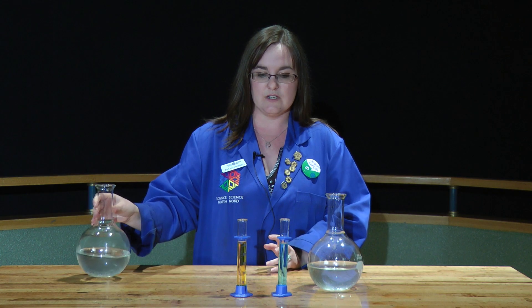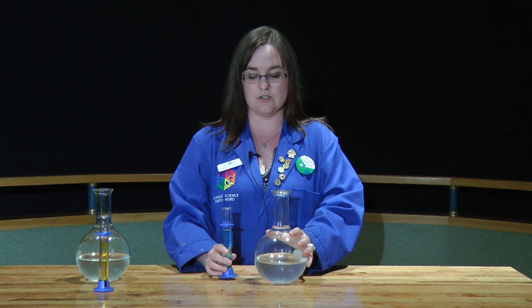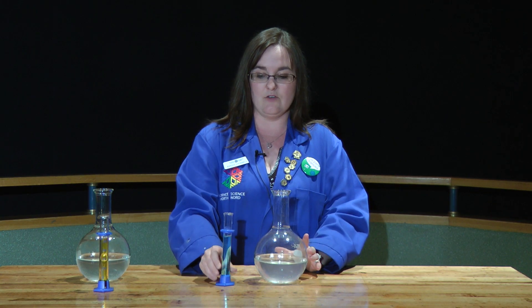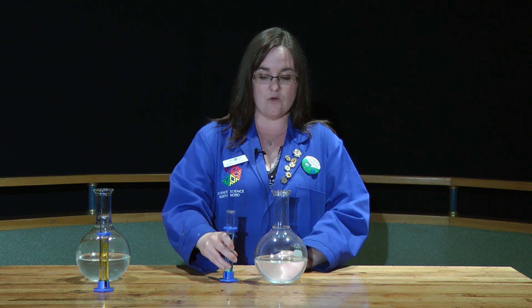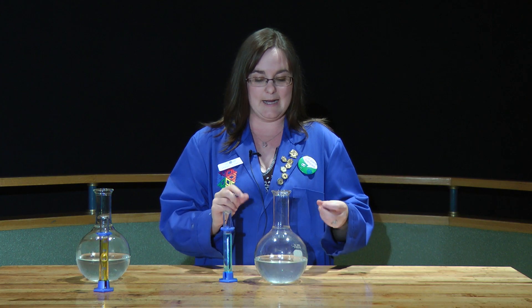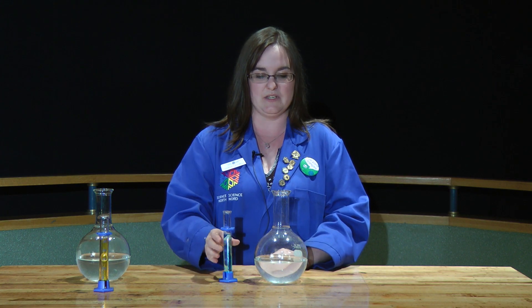The first we're going to do with these two substances here. In the round bottom flask, I have sodium carbonate solution. And in the graduated cylinder, I have copper sulfate solution. Now, when we mix these two together, a reaction ensues, and one of the products is not soluble in the other. So you get this solid kind of little tidbit stuff out of it, which is kind of neat, called a precipitate.